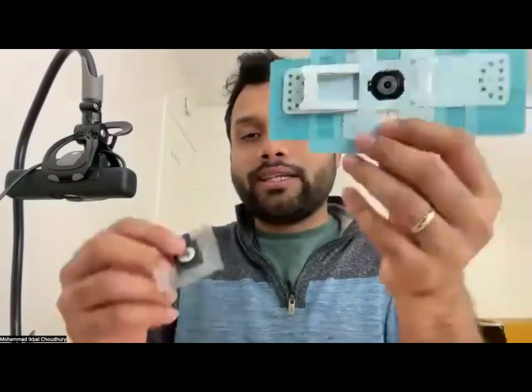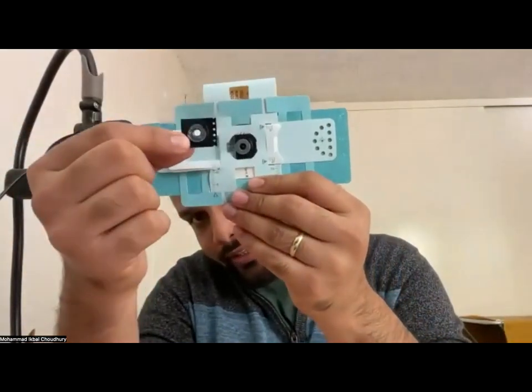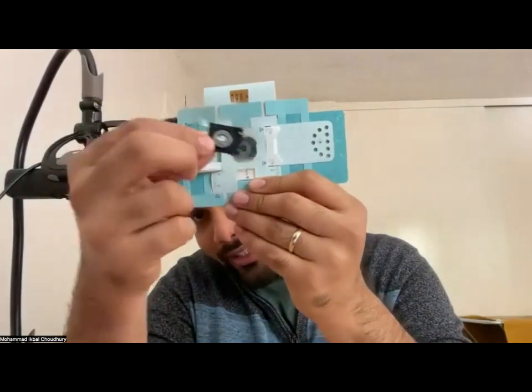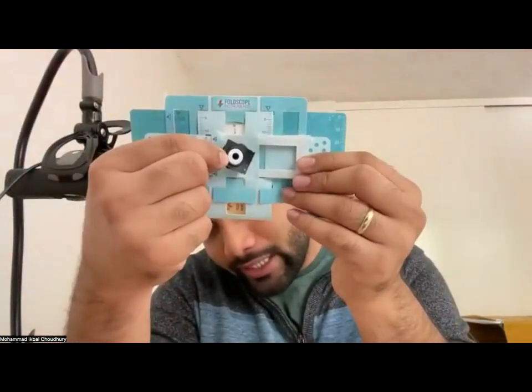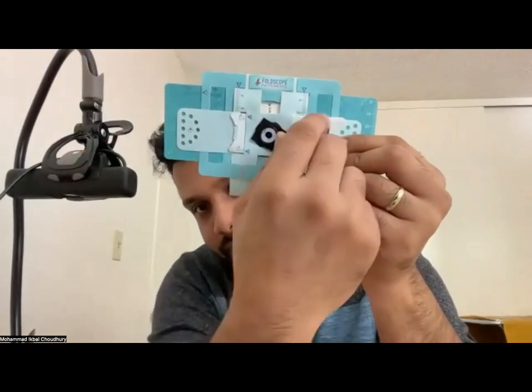That's it. Perfect. Okay. So this connector is magnetic. If you hold your foldscope like that, you will see that the connector snaps onto the lens, right where you were able to see through the lens, that side, the blue side. I think I hold it like that. So this magnet basically snaps onto the eyepiece.